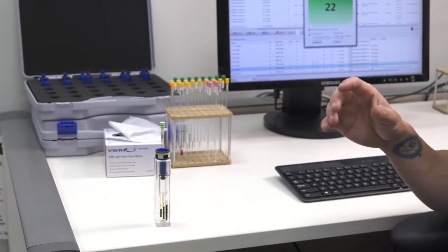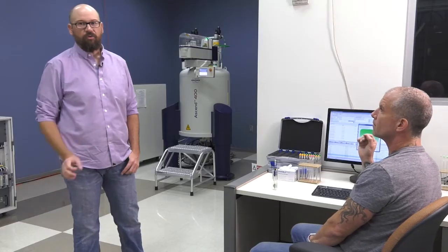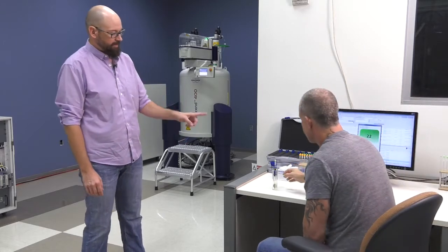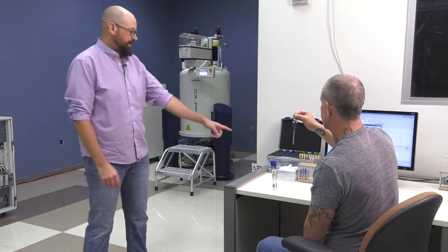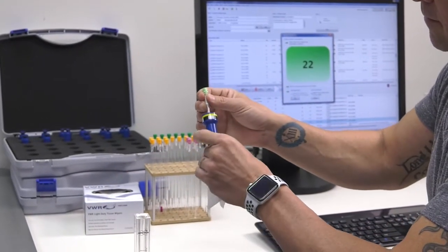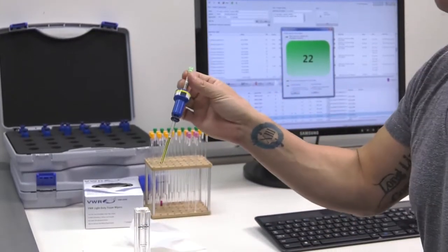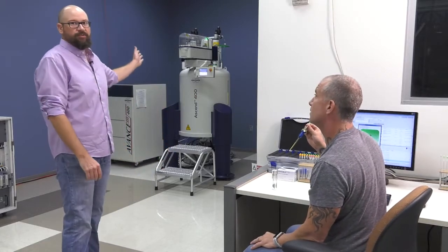There's a big button, step 3, and once you press that button, Icon NMR will tell you the location in our automated system where you should place your sample. So now you're going to take the sample, carefully picking it up by the NMR tube itself, not the spinner, and take a Chemwipe and carefully wipe off the portion of the sample that's going to go into the magnet down by the bottom. Like Jeff has there, that's good. That's to remove any residual things from your fingers or anything that came from the spinner itself and got on there. And now you're going to walk over and place this sample into the magnet.